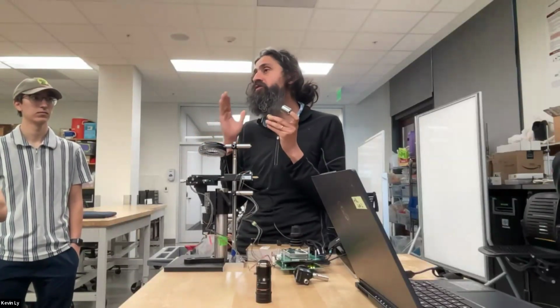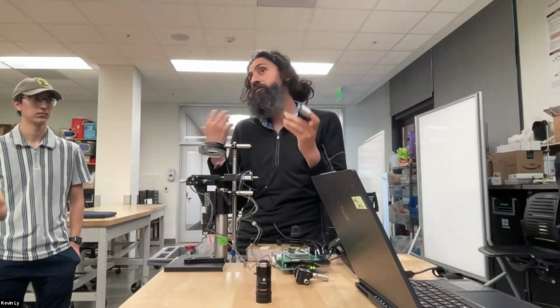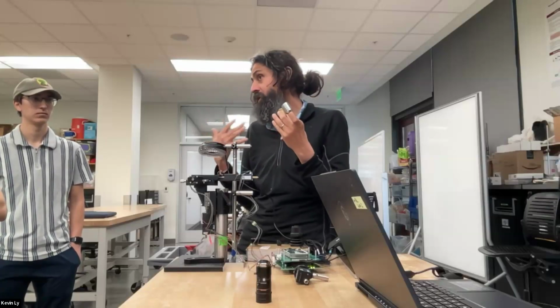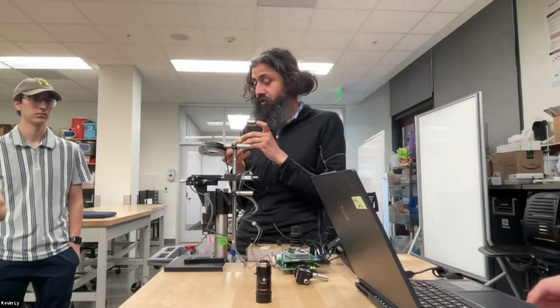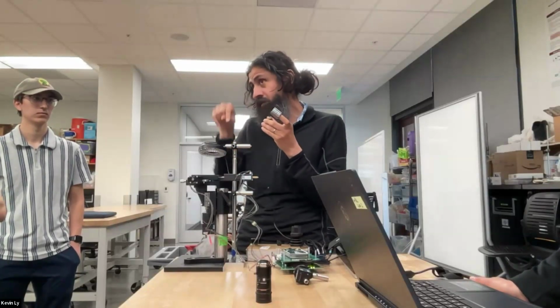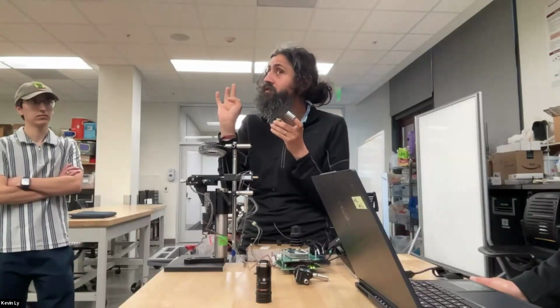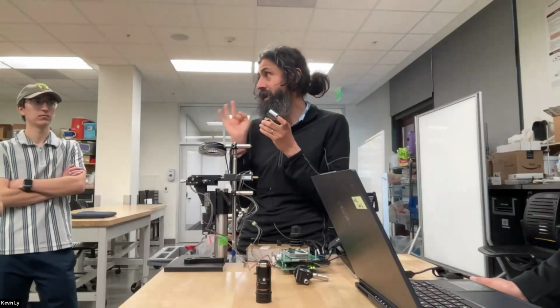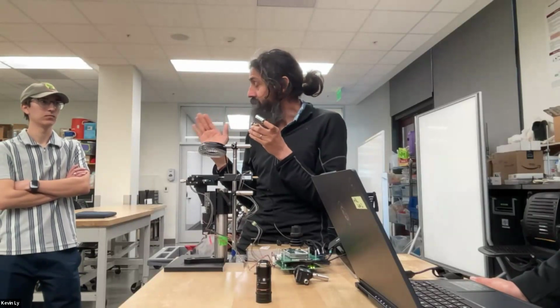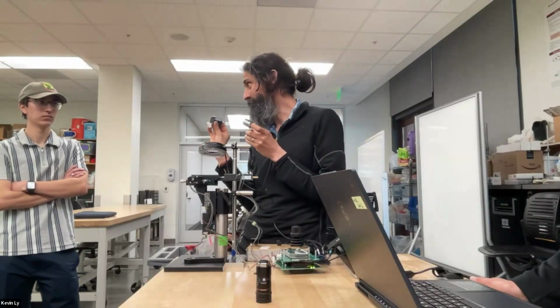So you cannot just use one lens. If you use one lens, you'll make one clean image for one color. That's not what we do in microscopy. All of these colors coming in would form blurred images for all the other colors. Similarly, your field of view: when you've written the thin lens equation and solved it, we assume that only a portion of the objective is actually forming a flat image, because the rest of the focal plane is not in a plane. We have not as yet invented technologies that make these sensors curved.